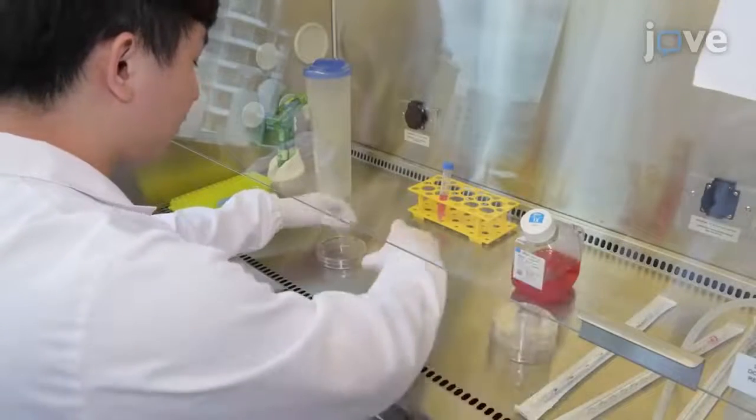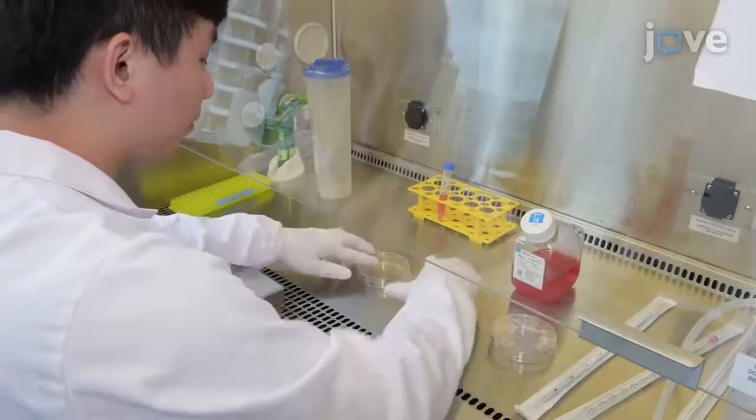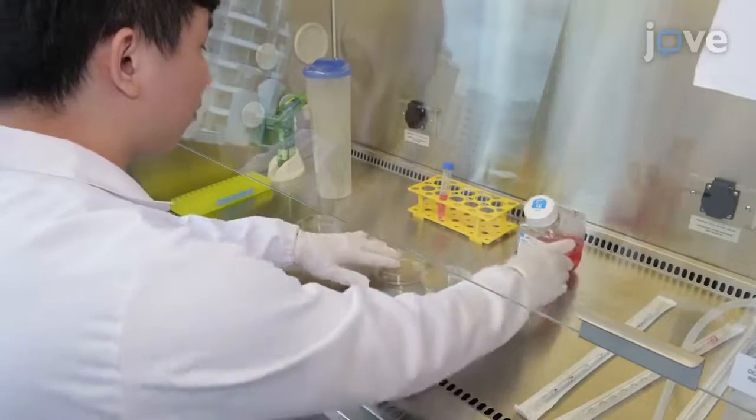This protocol uses human embryonic kidney 293A cells grown in four 10-centimeter dishes.